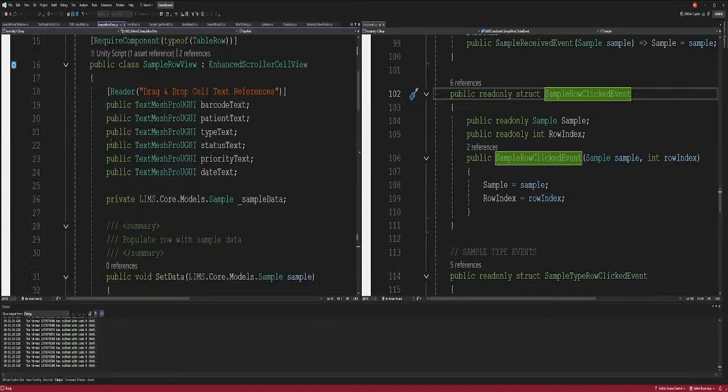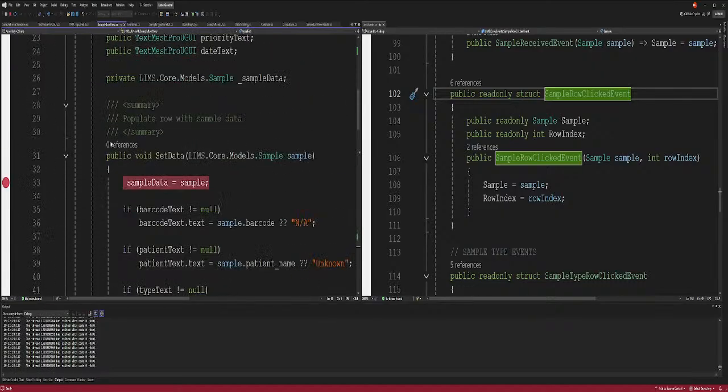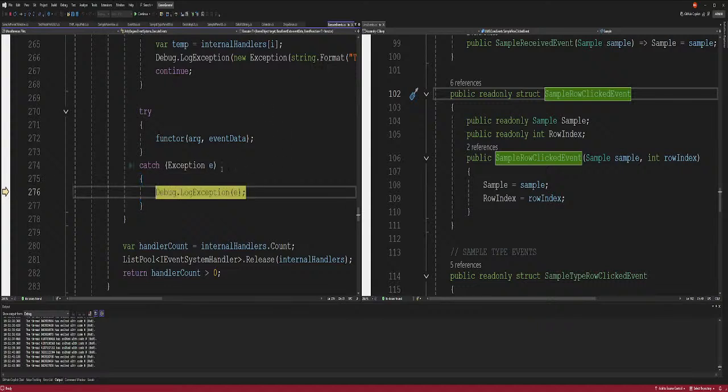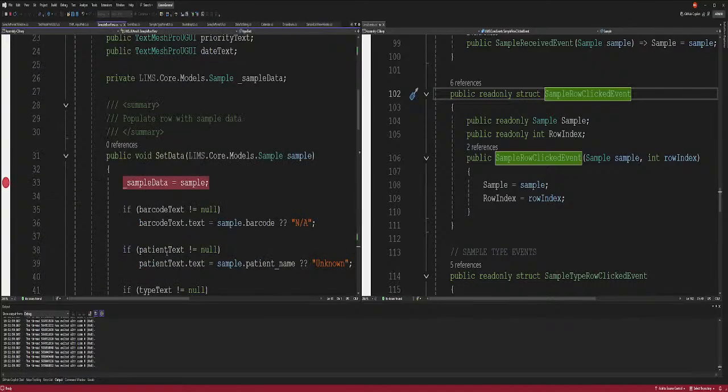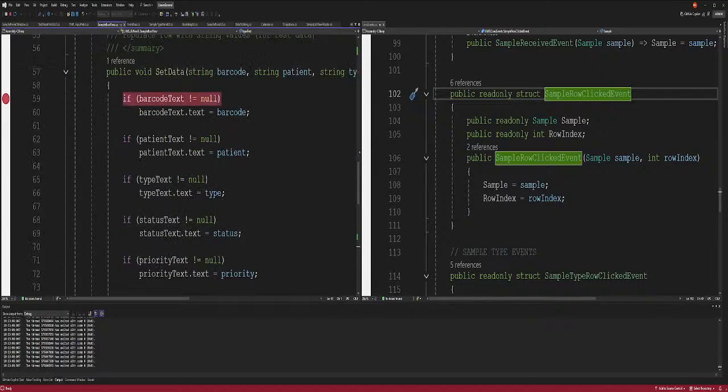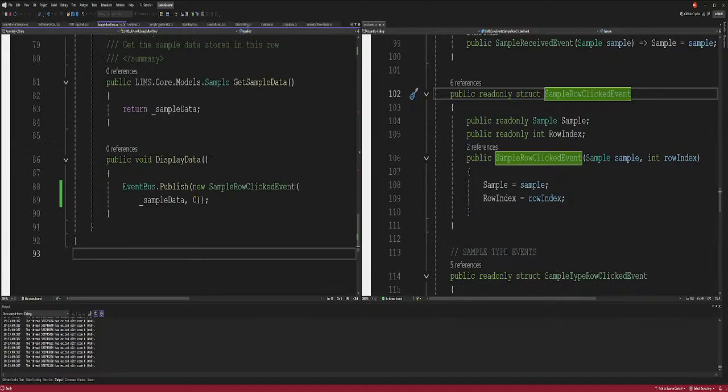Okay. Wait a minute. Why is that not running? Of course, the event, clicked event, right? Yeah, it keeps saying it. Okay, so the problem is this is not running as we expected it to. All right. Sample row view. Right, set data. This should be running all the time. I'm putting out set data. Maybe we're wrong. All right, let's try it again.